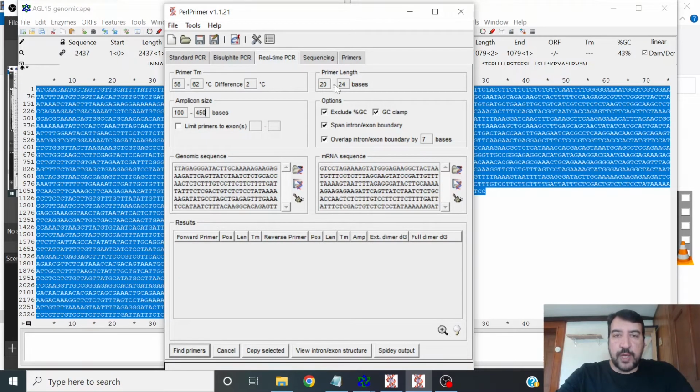You could change the primer length. This could be as little as 18 base pair length. Leaving the GC content and the GC clamp boxes checked is probably desirable. And if you're doing qRT-PCR, you definitely want to have this box checked because this will ensure that you're amplifying from cDNA rather than genomic DNA. This is just a parameter that goes along with this spanning.